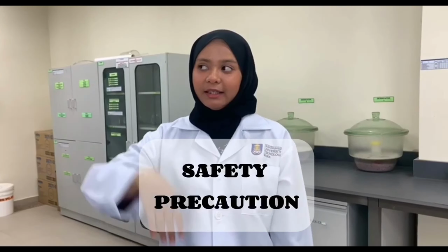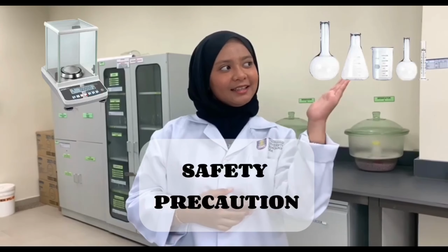Hello guys, today I'm going to talk about something that a lot of people ignore but is super important. Do you guys know what it is? We don't know. It's about safety precautions when handling analytical balance and volumetric glassware.